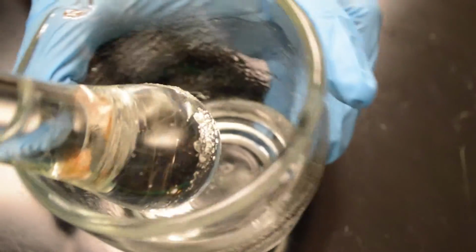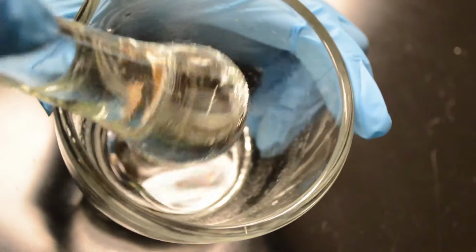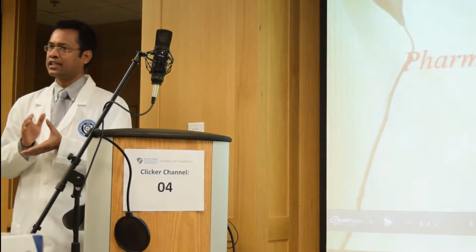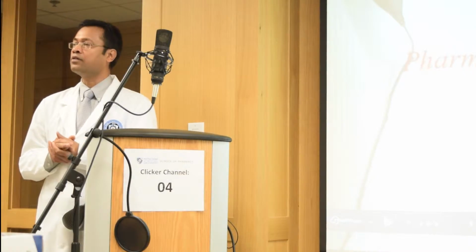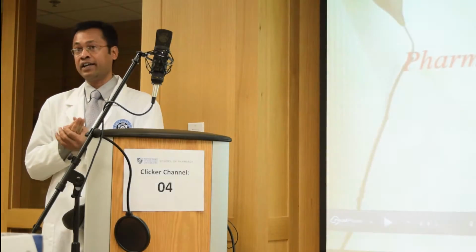So what is the final physical state of the product? Liquid. So mixing two solids, we are getting a eutectic liquid mixture. What do you guys think is the relevance of this lab with respect to the School of Pharmacy? What are the things that you really learned about this lab? Number one, how to use a mortar and pestle, right?